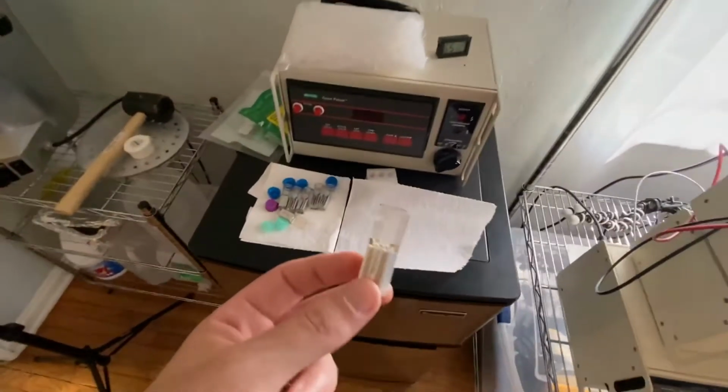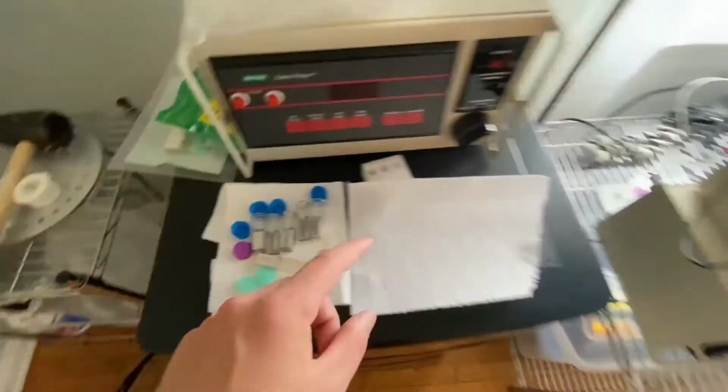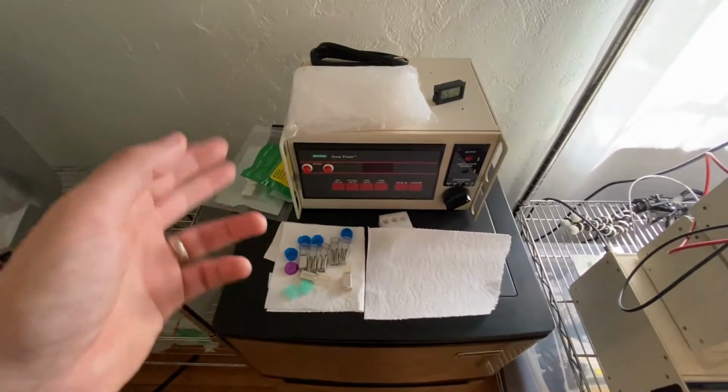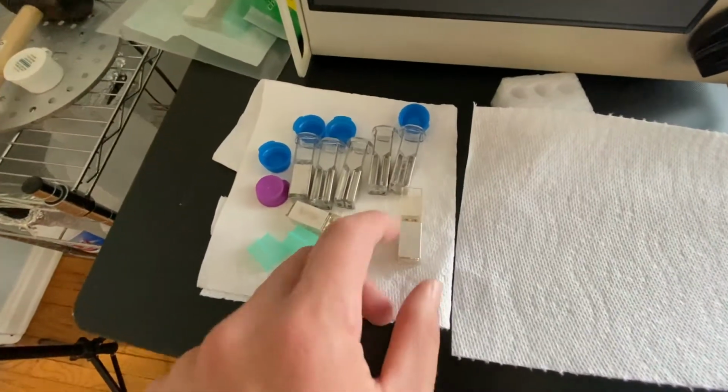So the point of recovery is to give them some fresh LB media, put them in the incubator and give them a chance to grow out and express the plasmid, and replicate, so that by the time we plate them, they don't just die when they immediately hit the kanamycin.